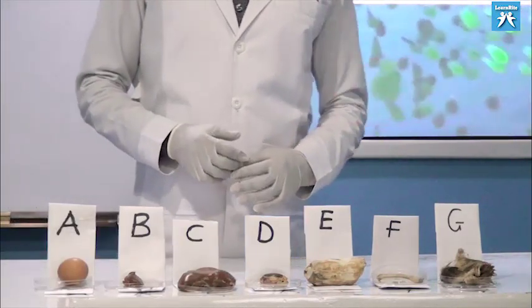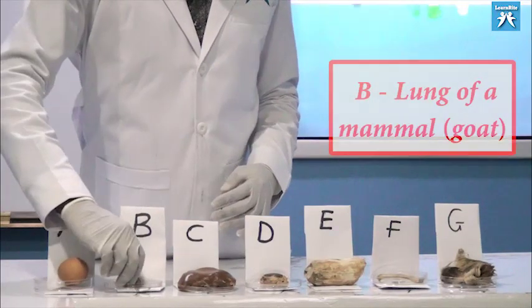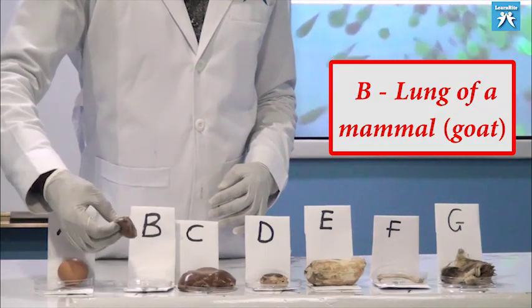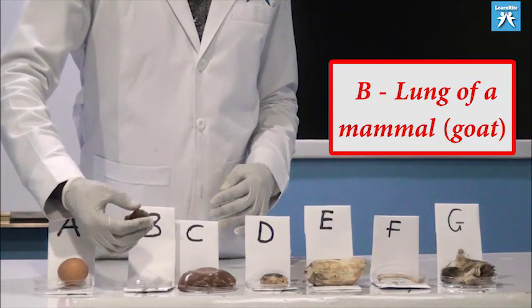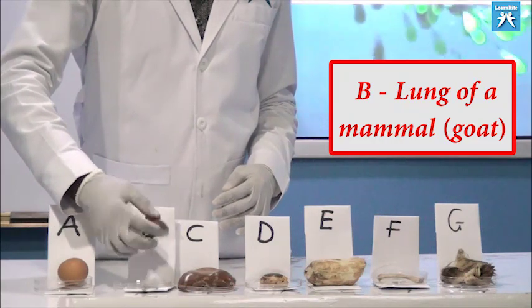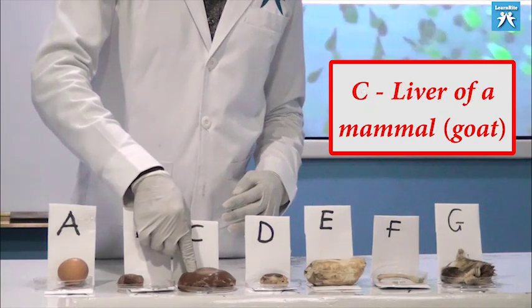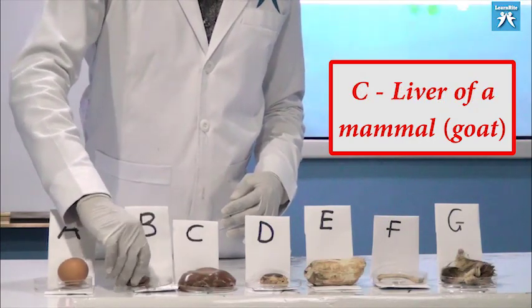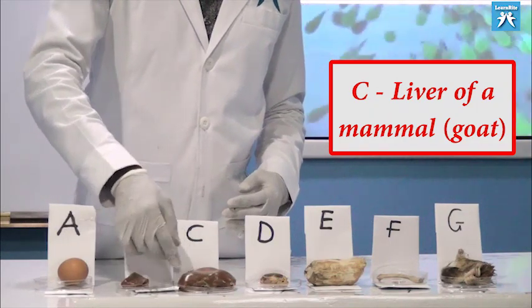Specimen B is the lung of a mammal, but this is the lung of a goat. How? It's pink. It's spongy. This is the liver, the liver of a mammal.